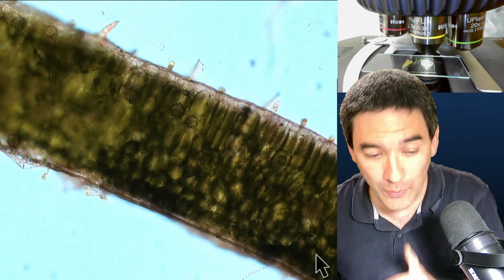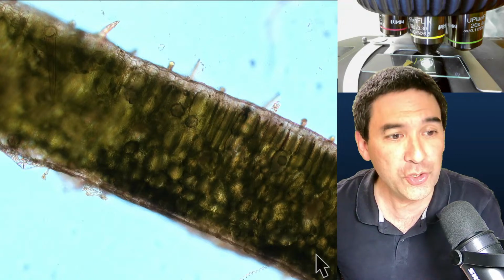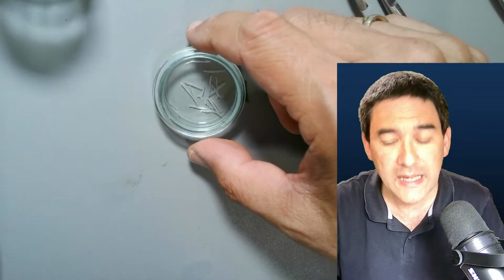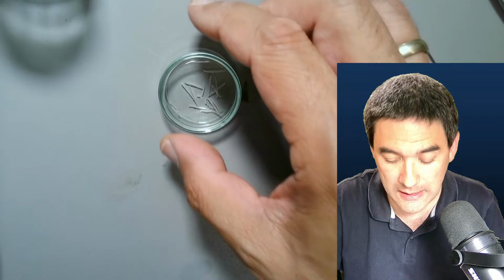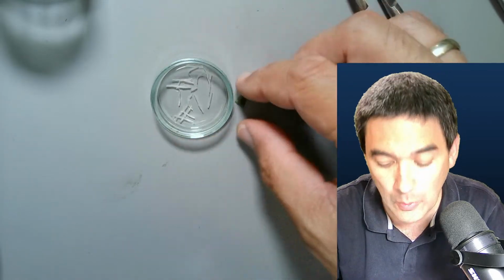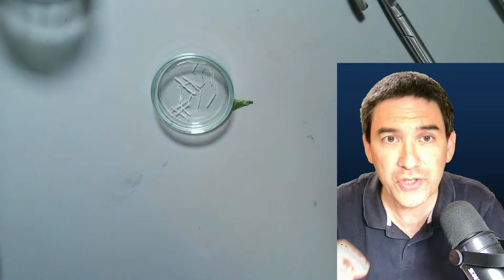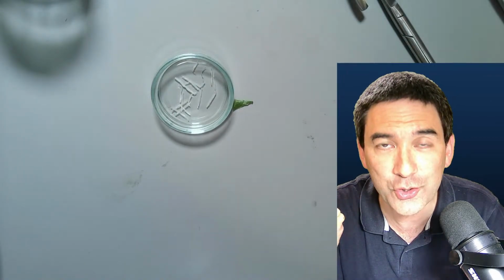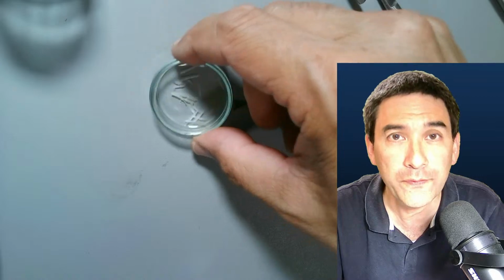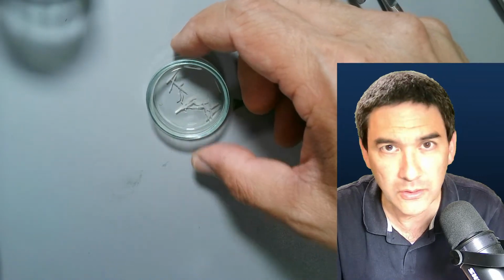However, I've already done a little bit of other preparation today as well. And what I would like to show you now is what I've done here. These are cuts that I made today in the morning. And look, what color do they have? They are white. Why is that? Because I put those thin leaf cross sections not into water, but into alcohol. And the alcohol removed the chlorophyll. It only took a couple of minutes.